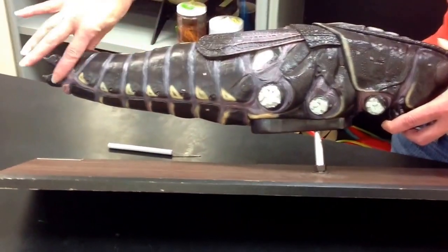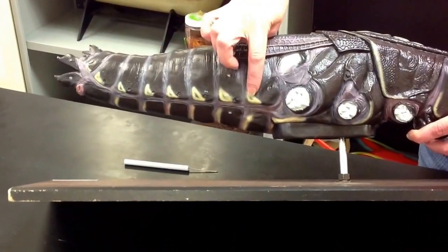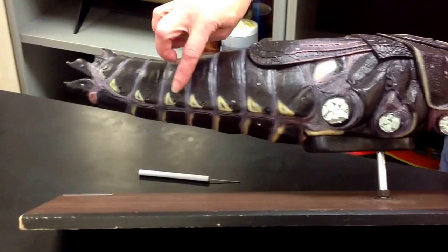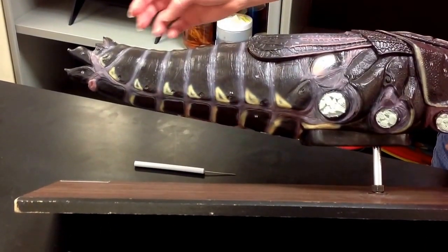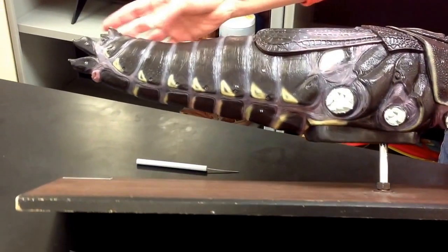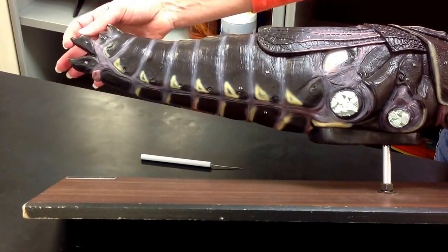The segmented area is the abdomen. Each of those segments has a spiracle for respiration. This is a female grasshopper — you can tell because the posterior end is forked.